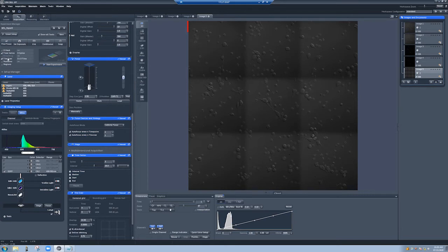But maybe, let's say you don't want to take all of these. For example, in this particular sample, there are some cells that seem attached and some cells that seem kind of floating around. So maybe you only want to take images of the attached cells because you only care about those. So maybe we just want to mark positions where those cells are instead of doing these 3x3. So how do you do that?